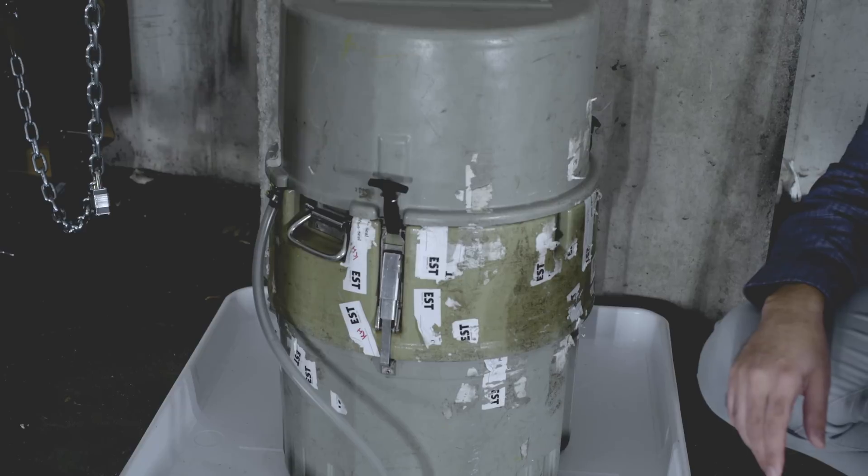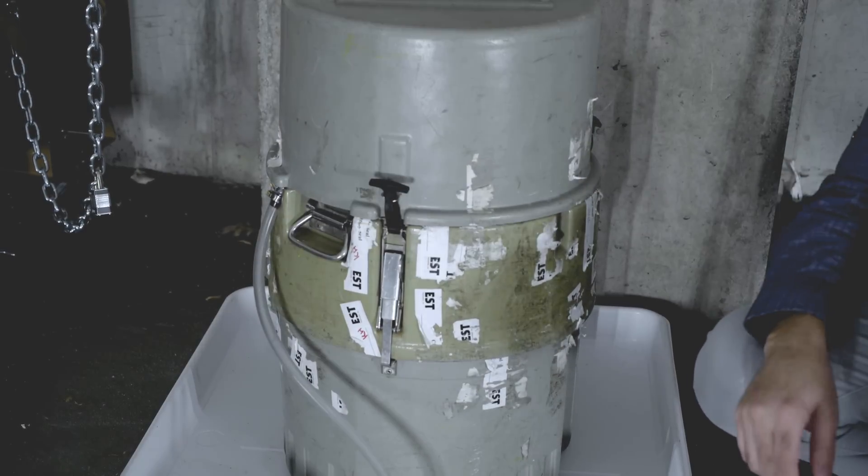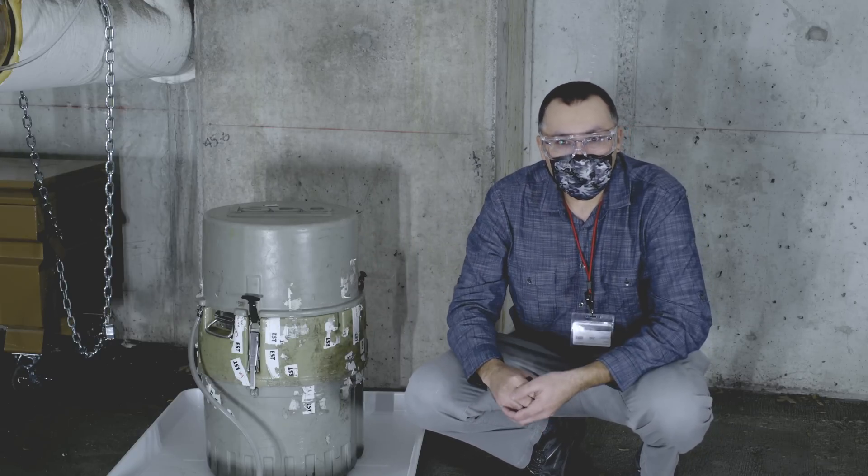For this project in particular, we looked at some of the sampling protocols. The technicians will come to the site every day. They open up this box inside. There's a container with the samples. They withdraw a small amount of that sample.